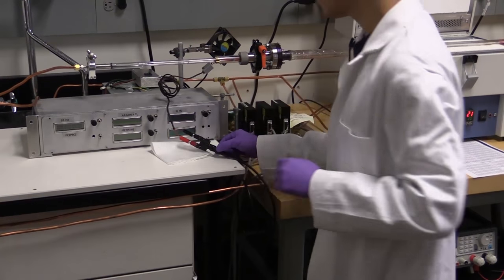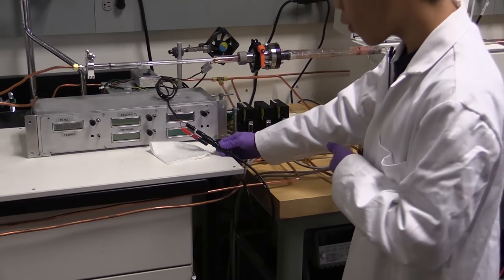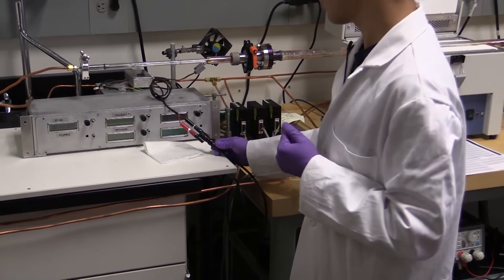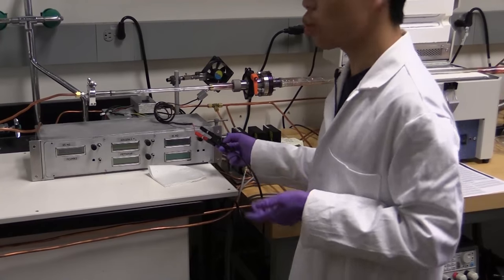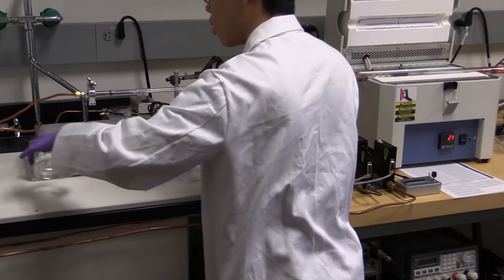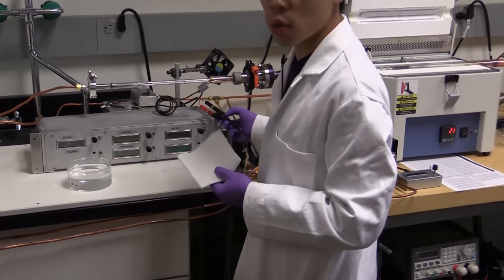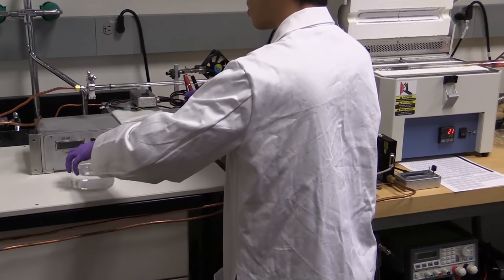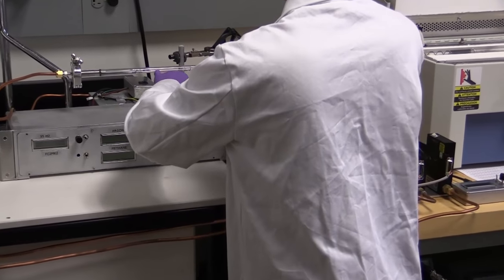Now, due to the low gauge of our thermocouple wire, the power that we put through it will actually cause it to get very hot. And a very high-tech solution is to cool the wire. Here, we'll just take a glass of deionized water, which won't conduct if something were to happen to our wire. And we're simply going to submerge the wire in it.